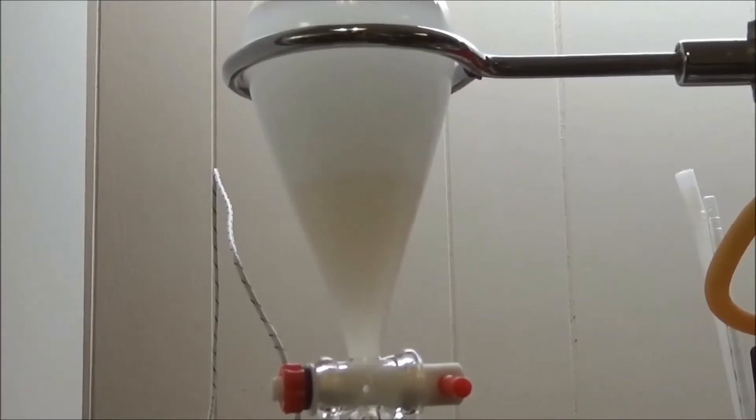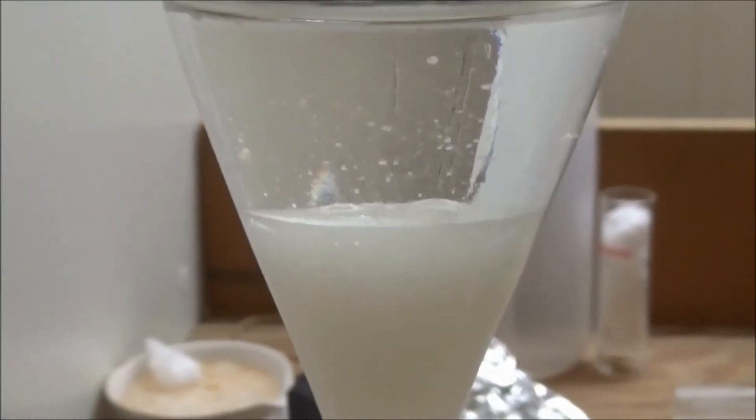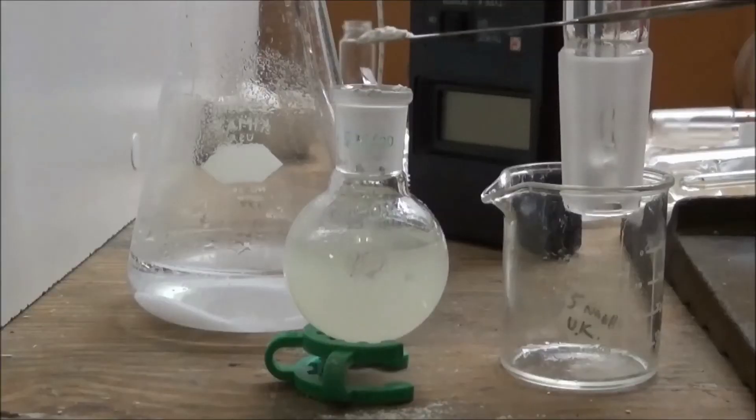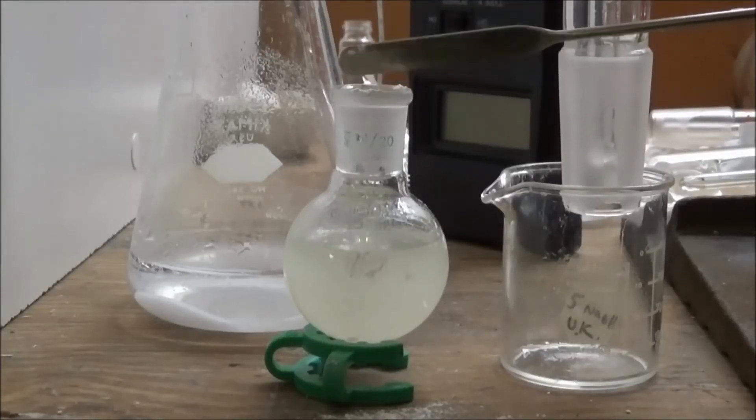Everything that remained was washed with water, sodium bicarbonate solution until it stopped bubbling, and then water again. The cloudy bottom layer was dried with anhydrous magnesium sulfate.